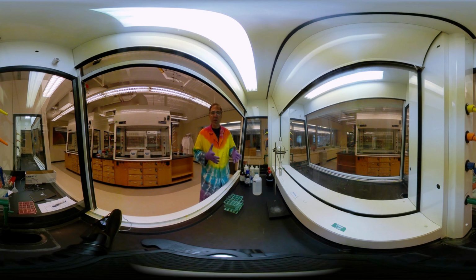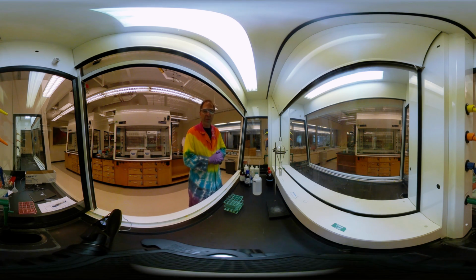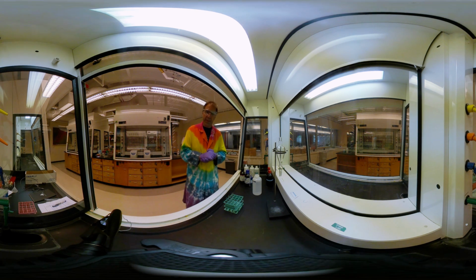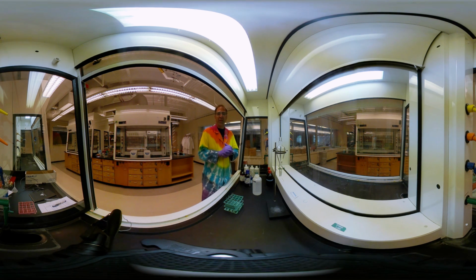Today we're going to be looking, though, at doing some extractions, and specifically we're going to look at liquid-liquid extractions. And the idea here is that you have a mixture of 2 soluble materials, and you want to separate them. And so we're going to use their differences in solubilities to be able to separate the 2 from each other. Not only that, but we're going to manipulate those solubilities a little bit by using some acid-base chemistry.